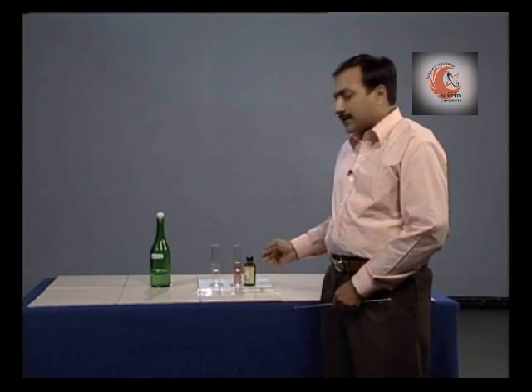Now, this method gives you very quick results, but simultaneously they give quite approximate values. However, for routine analysis they provide a good guideline. In order to make precise measurements, we must adopt the iodometric or spectrophotometric method.